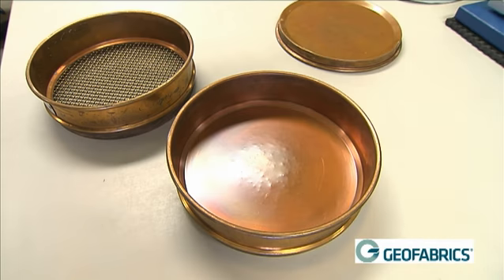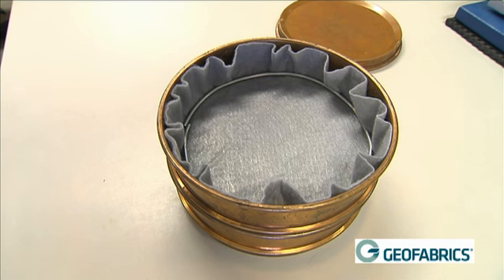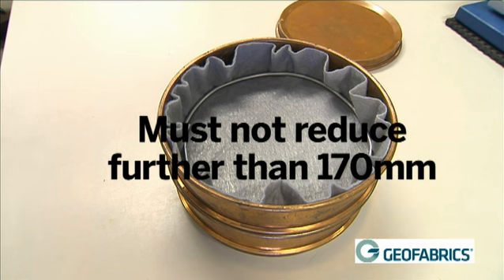The support sieve is placed on top of a collection pan. This is how the sand passing later is collected. The specimen is clamped into a support sieve with a clamping ring. The support sieves are 200 millimetres in diameter, and the support ring must not reduce further than 170 millimetres.